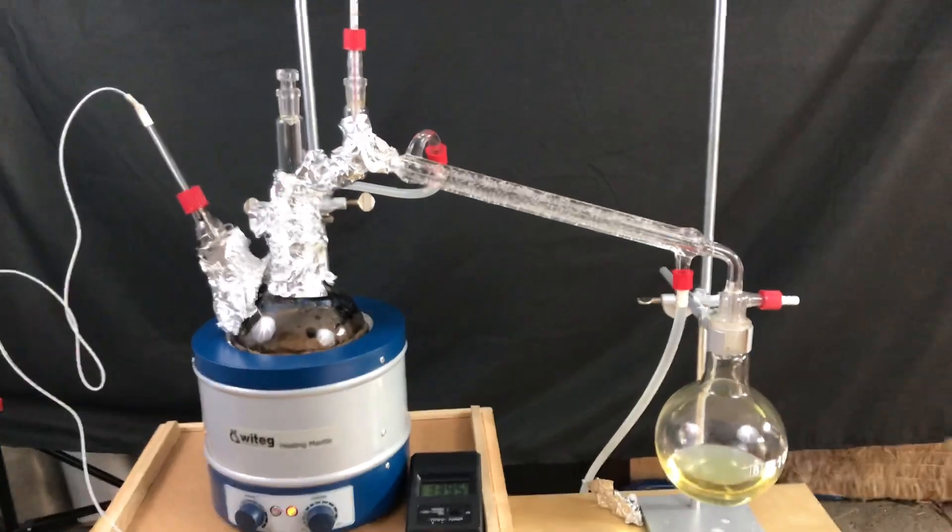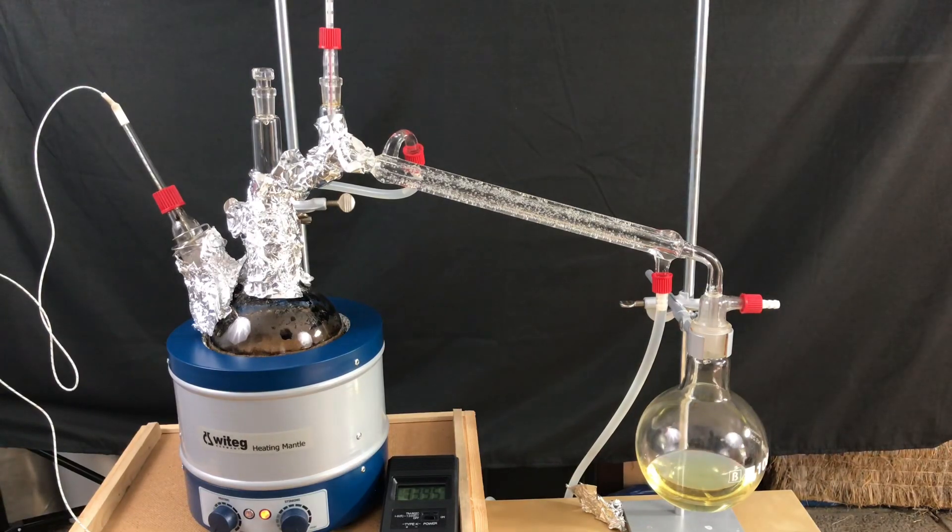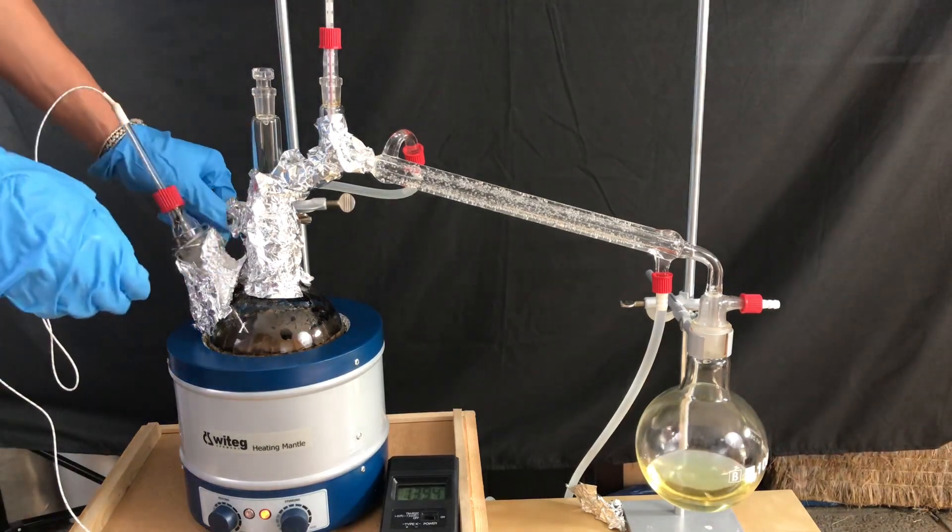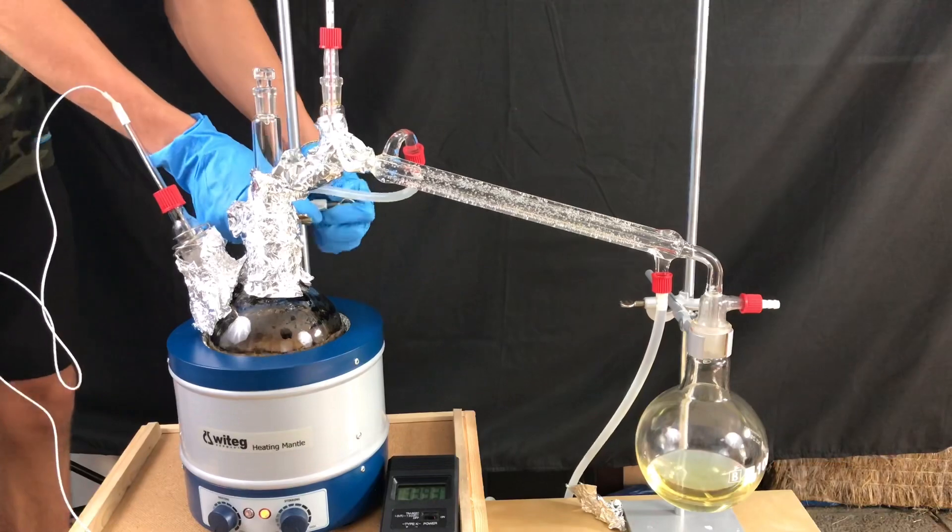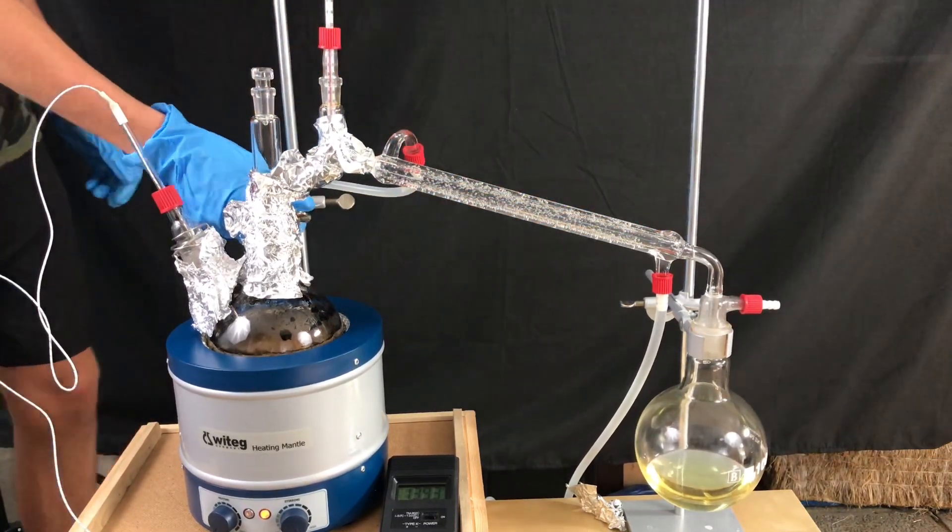This preparation takes really long and I didn't want to waste much more time on it. So I stopped the distillation right then and there after we collected 250 milliliters of our distillate. Because I stopped early this will definitely decrease our yield. But I didn't want to risk any more overflowing or whatever. So I decided to stop the reaction.